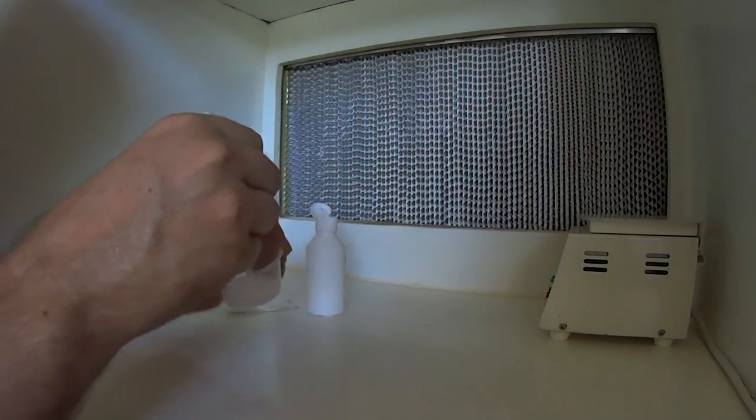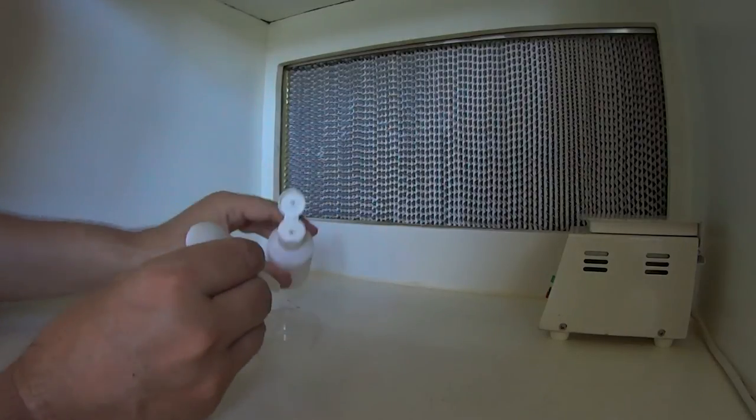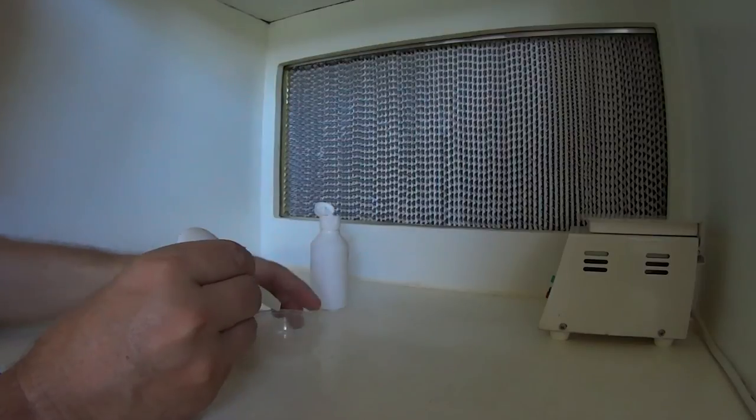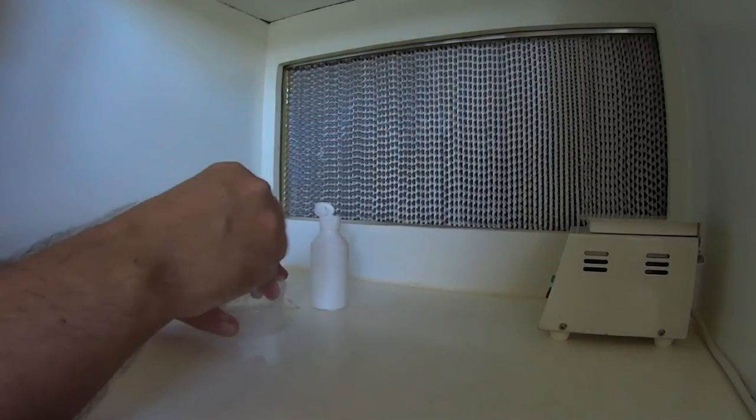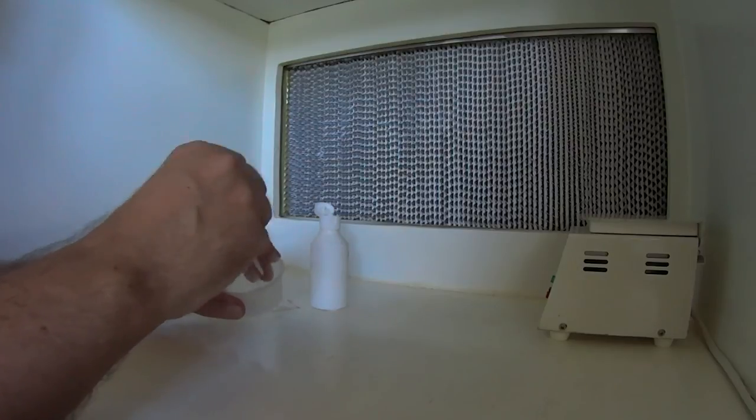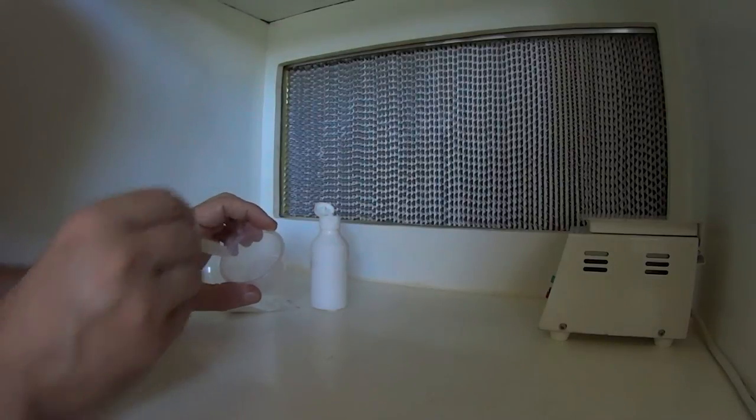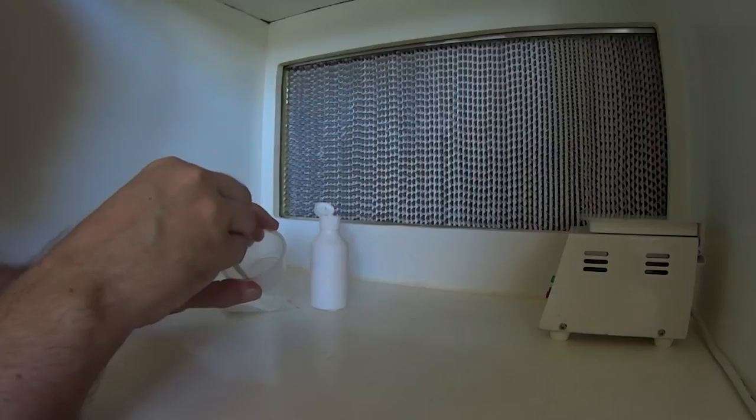I don't know if you can see in there, it's pretty much dissolved. Might just add another drop or two. There we go. Give it a good stir. Pretty much dissolved. Really you shouldn't see any particles floating around in there. I've got one, but that'll dissolve very shortly.